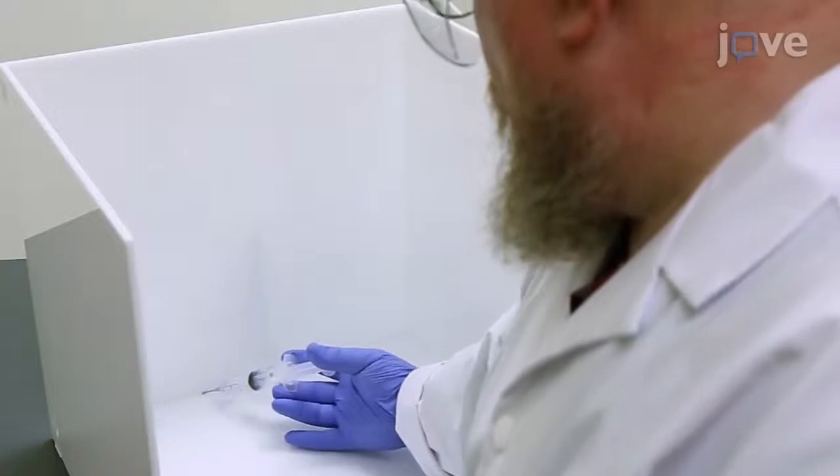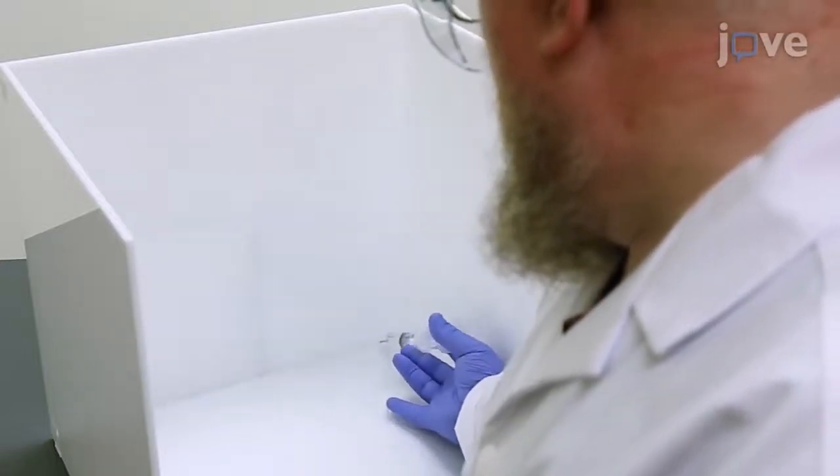Then, attach two inner walls, one at a time, to the base with acrylic cement.